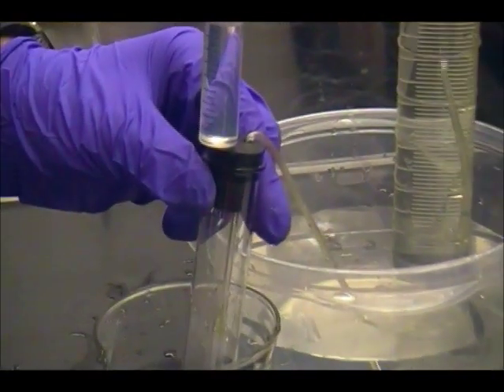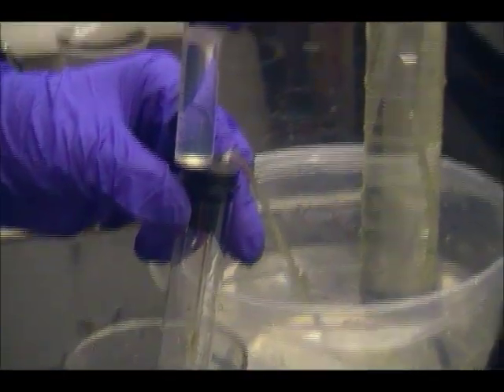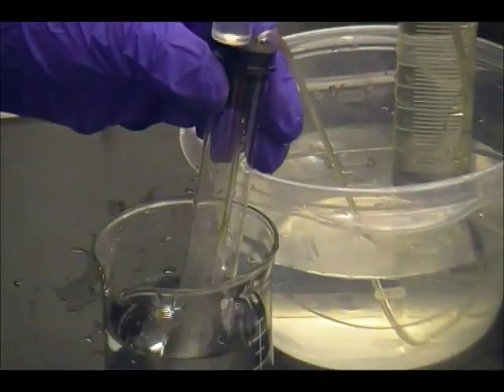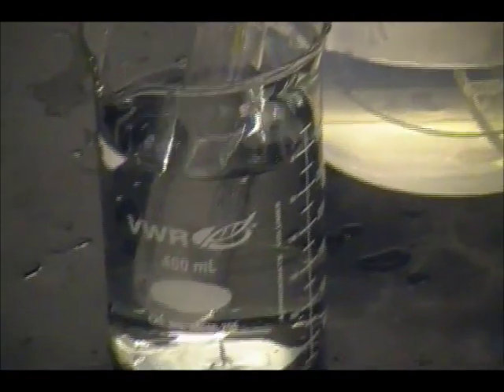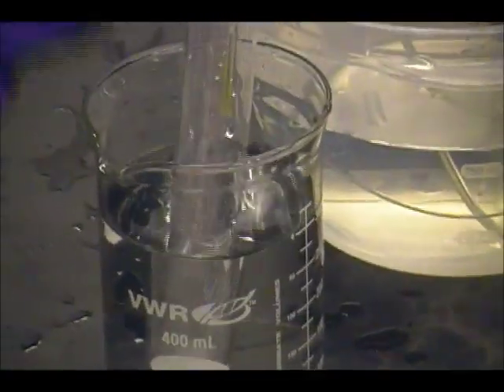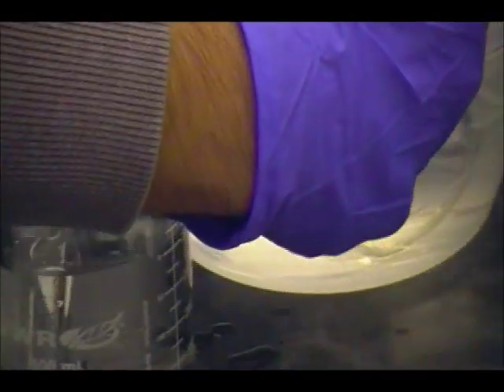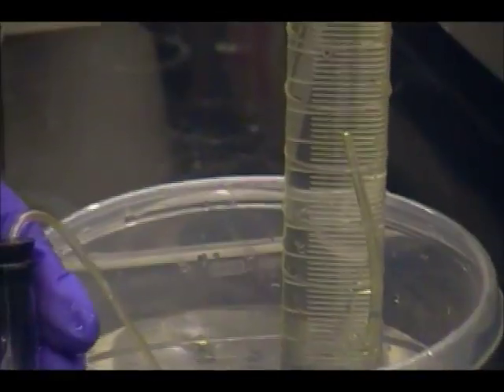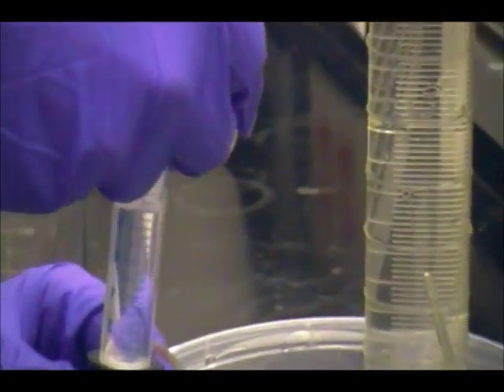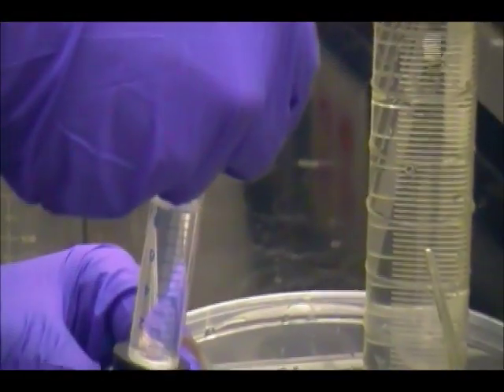And you can see the bubbles in the test tube, and that indicates that the reaction is taking place. And if it's bubbling really violently, then you want to stop adding HCl altogether and wait for the hydrogen gas to travel from the test tube along the hose to the graduated cylinder. And once you see that bubbles have stopped traveling, then you should start adding the hydrochloric acid again, because you are no longer in danger of popping the stopper off of the test tube.